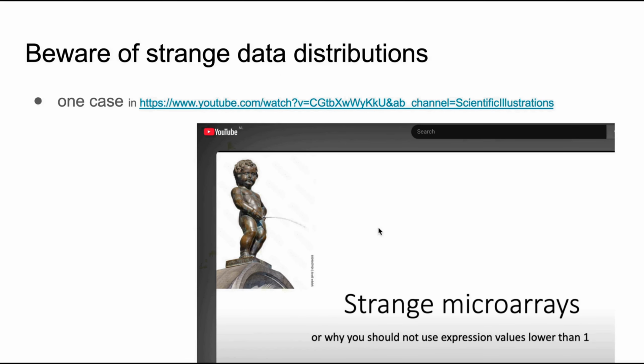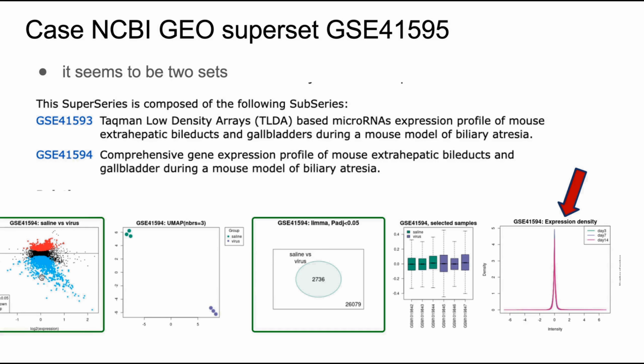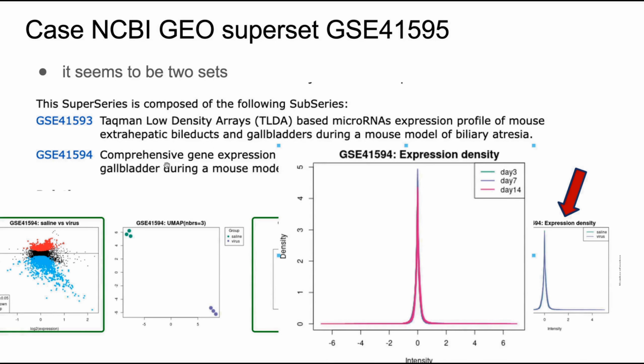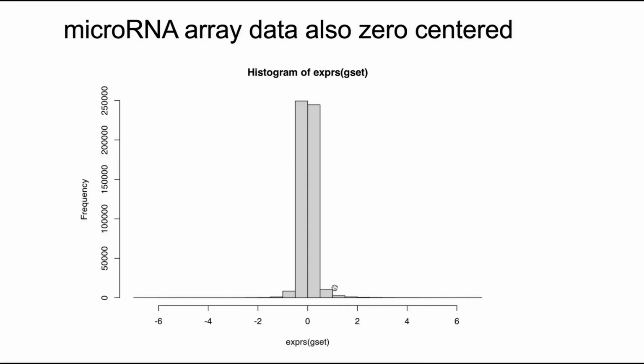Previously I showed you one case of strange microarrays where the data distribution was pretty weird and it was fixed by filtering negative values. Here is another example where you see that something strange is happening in the MA plot, and if you look closer at this slide, you see that all the data are zero-centered and very narrow. These are data for microRNA arrays and gene expression arrays, and in both cases they are zero-centered.